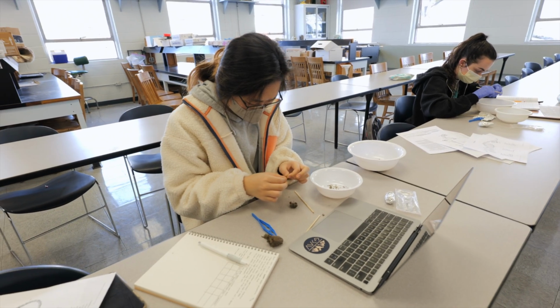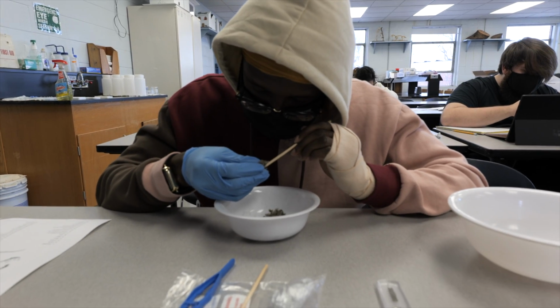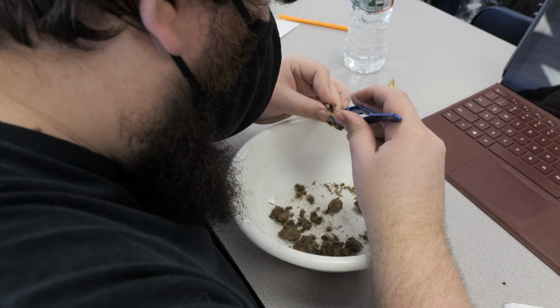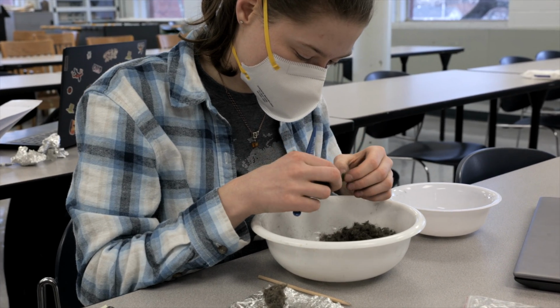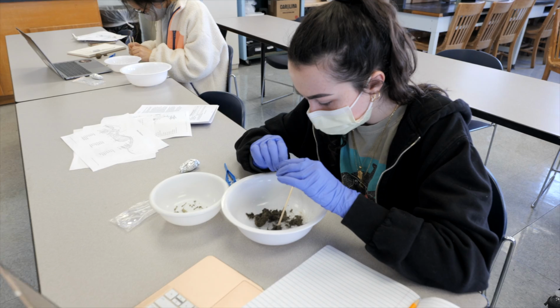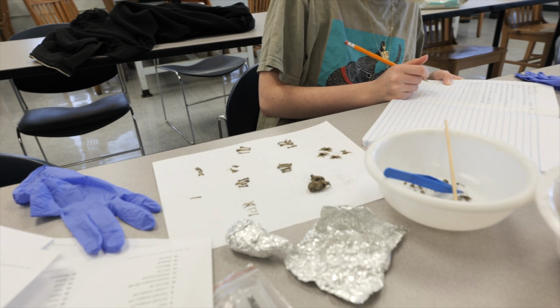Owl pellets are the indigestible bits of bone and fur from the owl's prey that are regurgitated on a frequent basis. Here, my students are dissecting pellets from barn owls in various regions of the United States to see how their diets may vary. They separate and identify the bones in the owl pellets and compare the skulls and jaws of the prey items to a key to determine which animal was eaten.